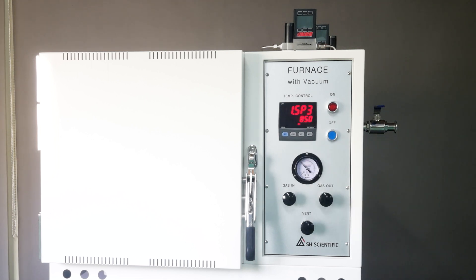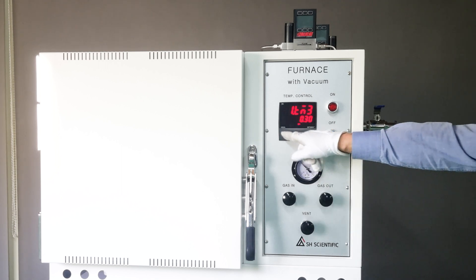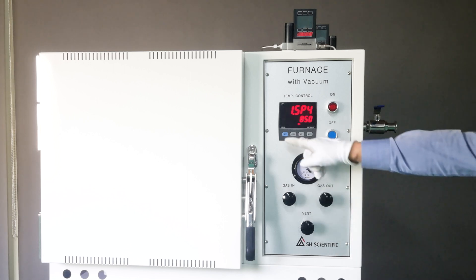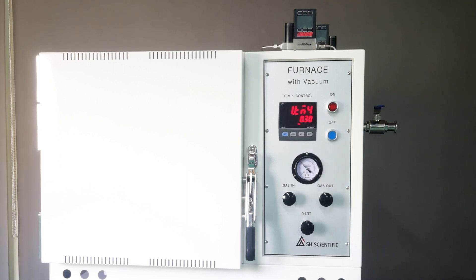Next, you'll be prompted for the third temperature and time. I'm using 850 degrees Celsius and 30 minutes. After that is the fourth temperature and time, so I'll use 850 degrees Celsius and 30 minutes again, which tells it to hold 850 degrees Celsius for 30 minutes.